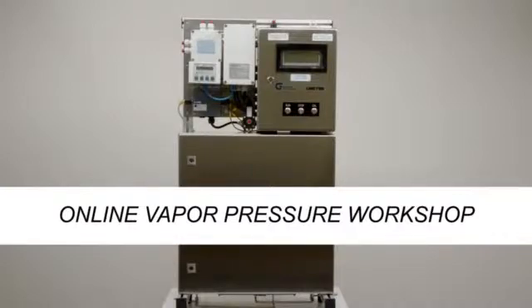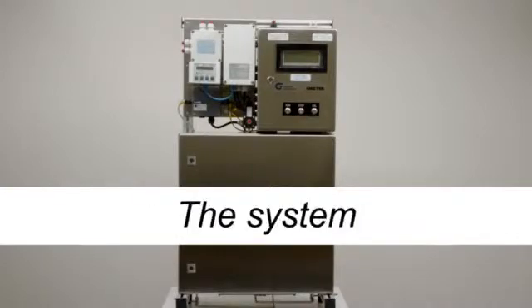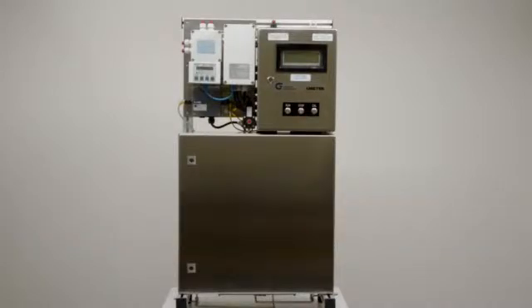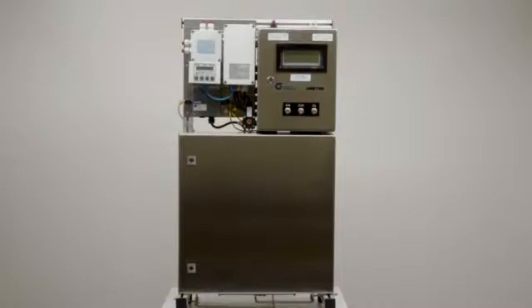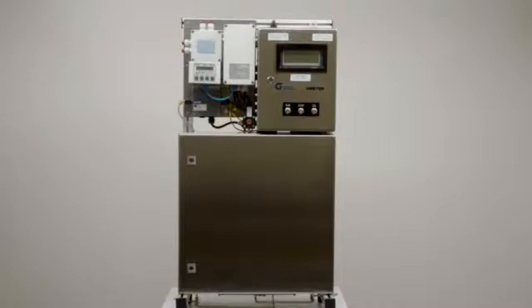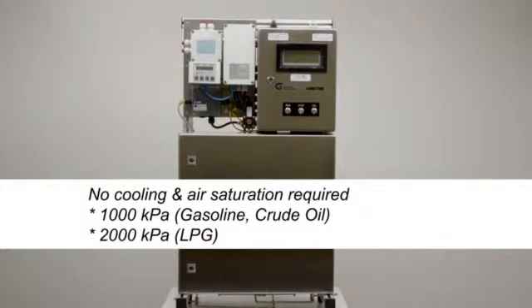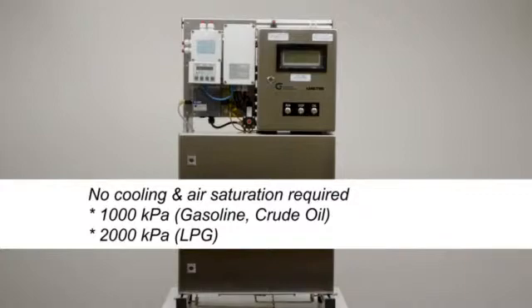Online Vapor Pressure Workshop. The system, the MINIVAP Online Vapor Pressure Process Analyzer, does not require sample cooling and air saturation.